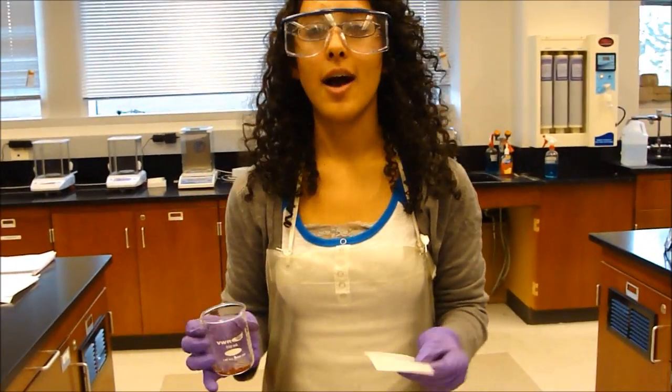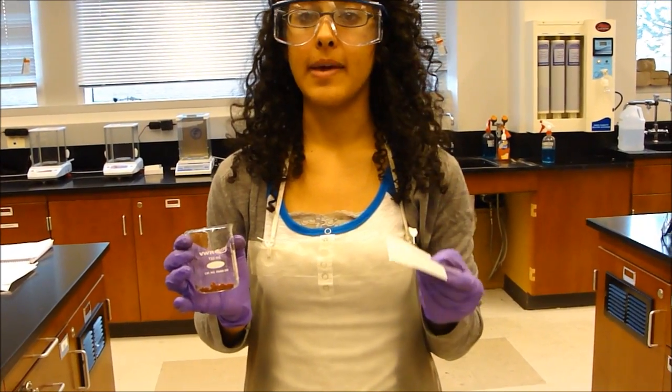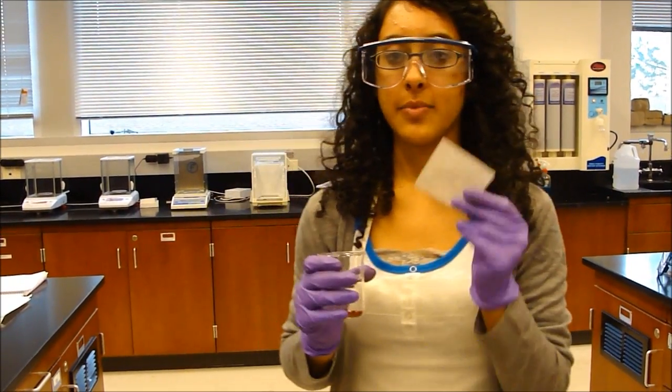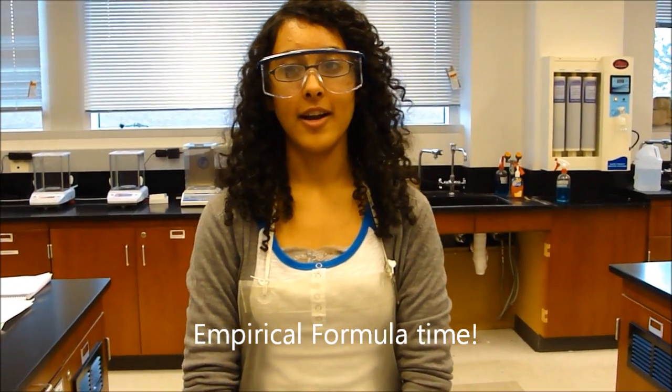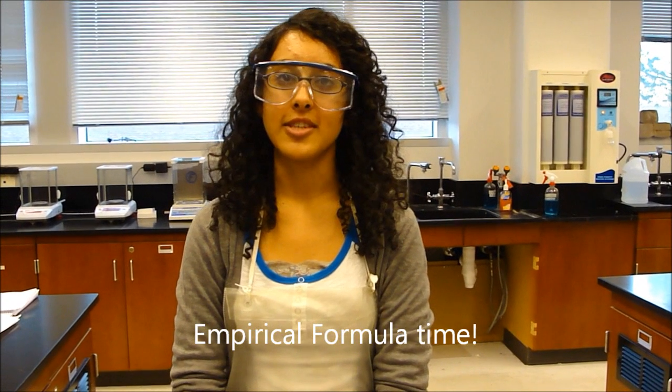In the end, you have the option of weighing the copper in the beaker or transferring it to a weighing paper, like the manual says. The first method is more efficient because it will prevent the loss of copper from flying away when transferring it to weighing paper. But you'll need to subtract the weight of the empty beaker from the total. Now that you have the mass of the copper, you can finally determine the empirical formula using stoichiometry.